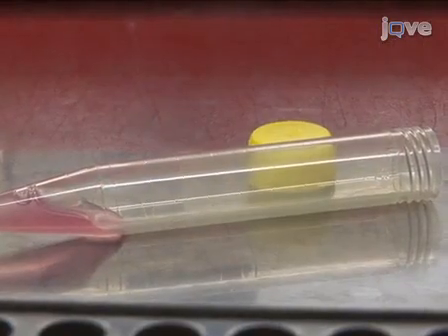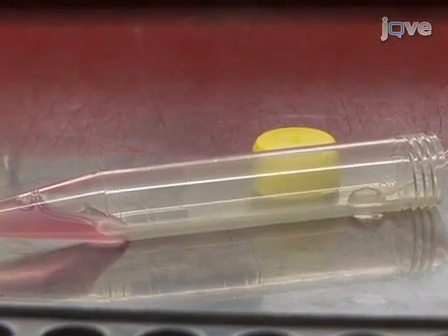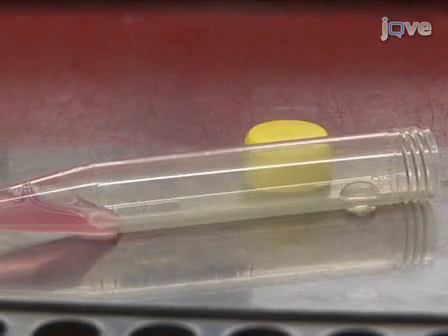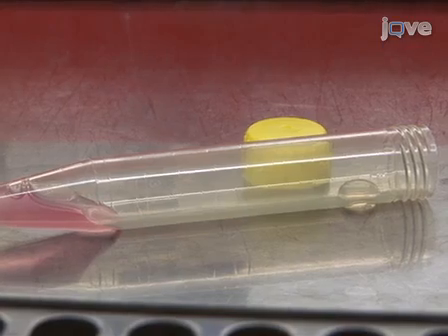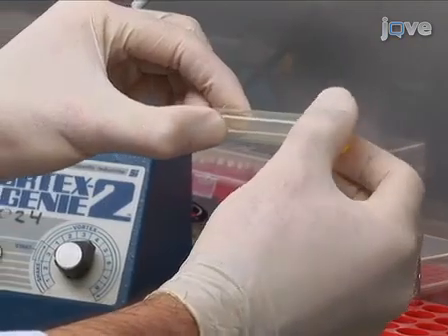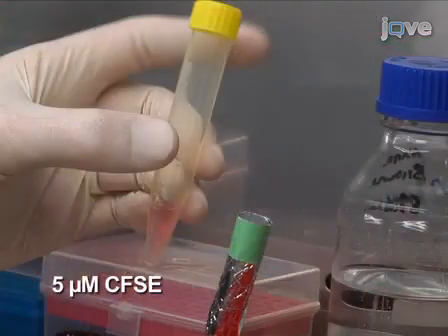Carefully add 110 microliters of PBS to the top of the tube in the non-wetted portion of the plastic, ensuring it does not make contact with the cell solution. Add fresh dye solution of 1.1 microliters of the 5 millimolar stock of CFDA-SE to the 110 microliters of PBS. Quickly cap the tube and invert and vortex well to get quick uniform mixing of the solutions.